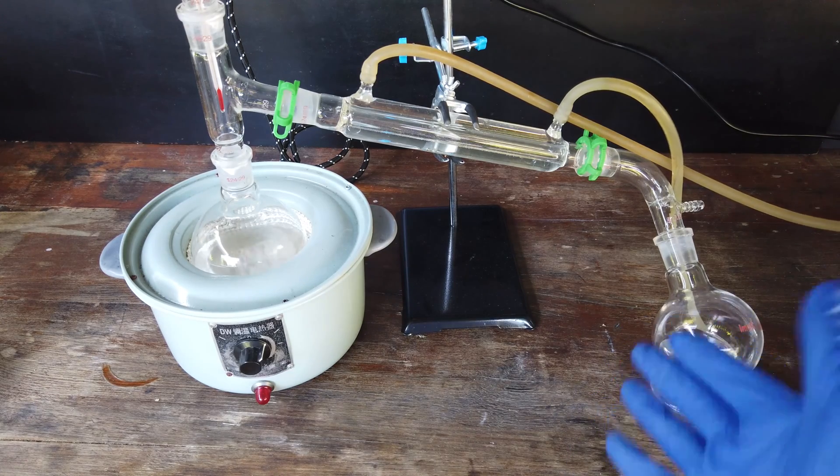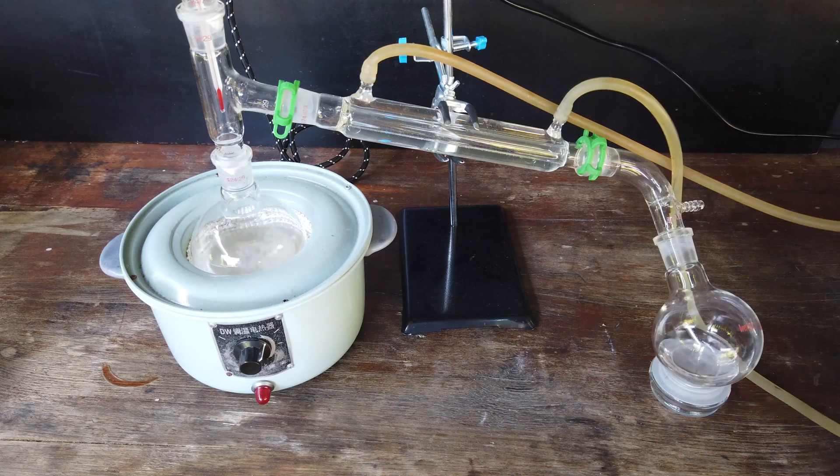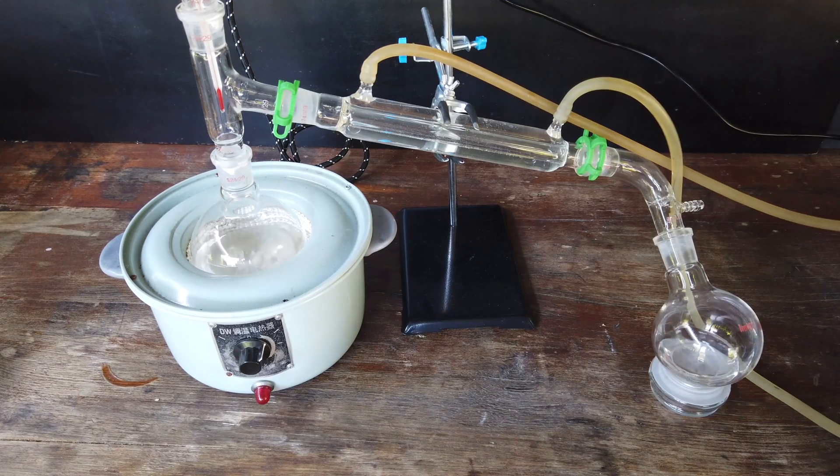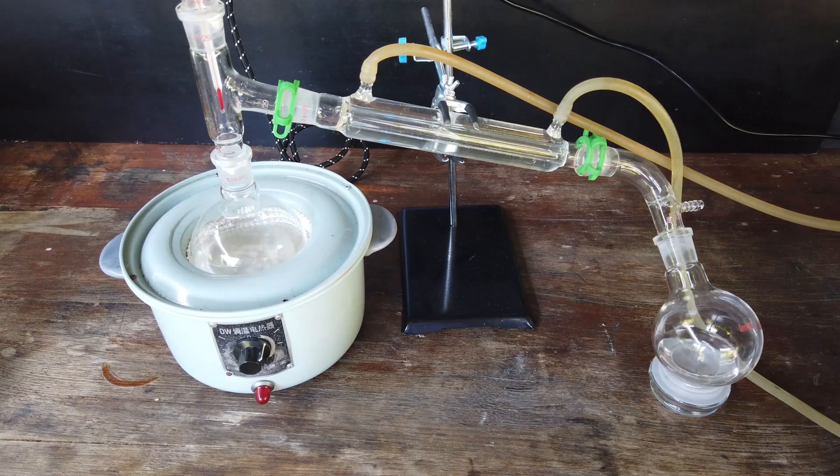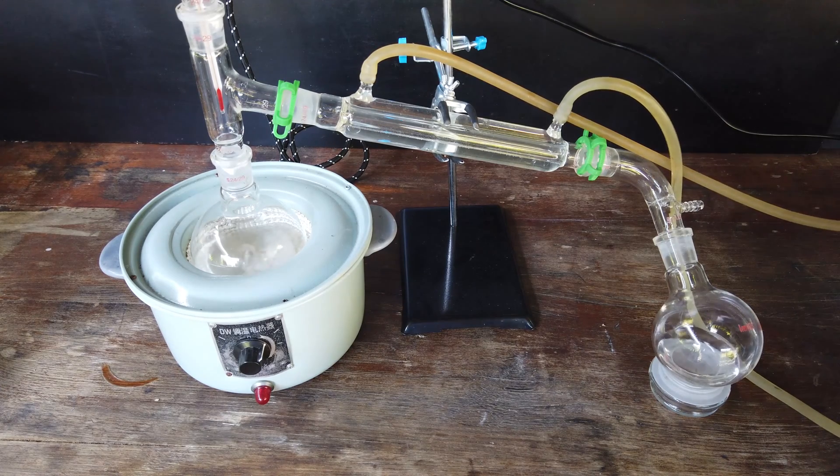Quite honestly, this is about the fastest distillation I've ever seen. You can see a whole bunch of solvent collecting in the receiving flask right now, and all of that is collecting between 75 and 80 degrees Celsius.